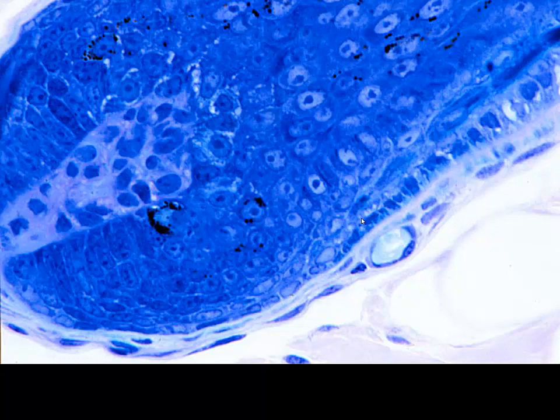And there's the bulb of the hair. Again, mostly here we're just looking at the dermal papillae that we see here on the left. Glassy membrane coming down and around. External root sheath really narrows until the point you really can't see it. Internal root sheath goes away, and then we just have the regenerative part where we're mostly looking at cells that look like stratum spinosum.